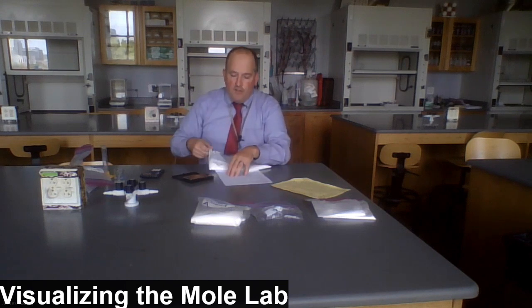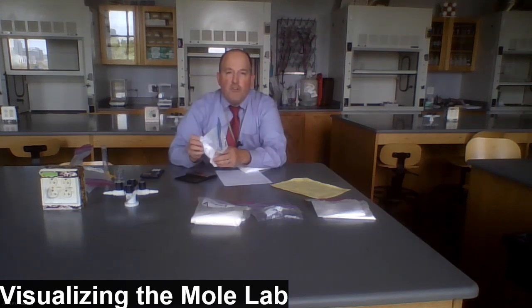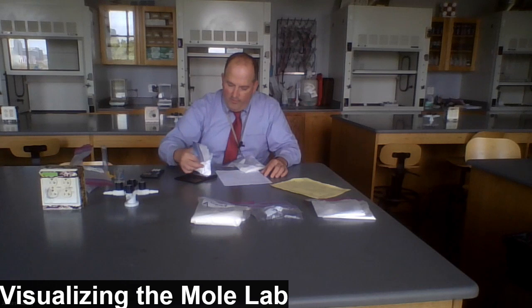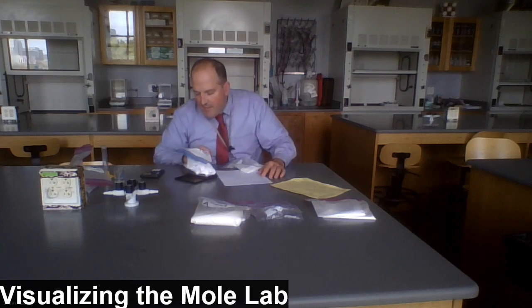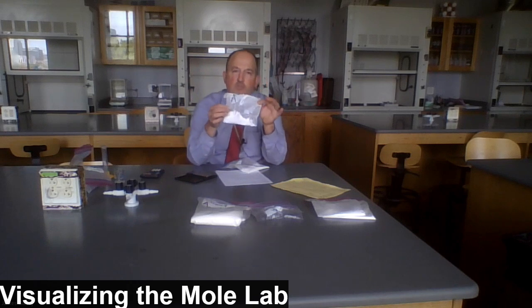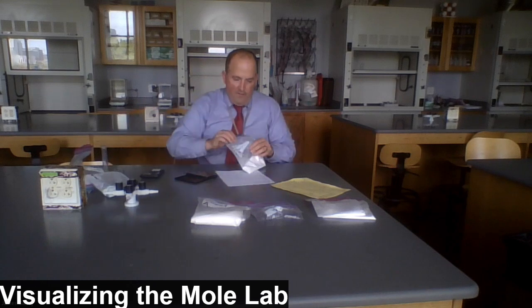Let's first weigh the two samples. And I'm going to show you some work on the board to clarify station 3. But for right now, let's record the masses. Sample A has a mass of 105.4 grams, 105.4. And if I subtract out the mass of the bag itself, which is 5 grams, that leaves us with 100.4 for sample A.